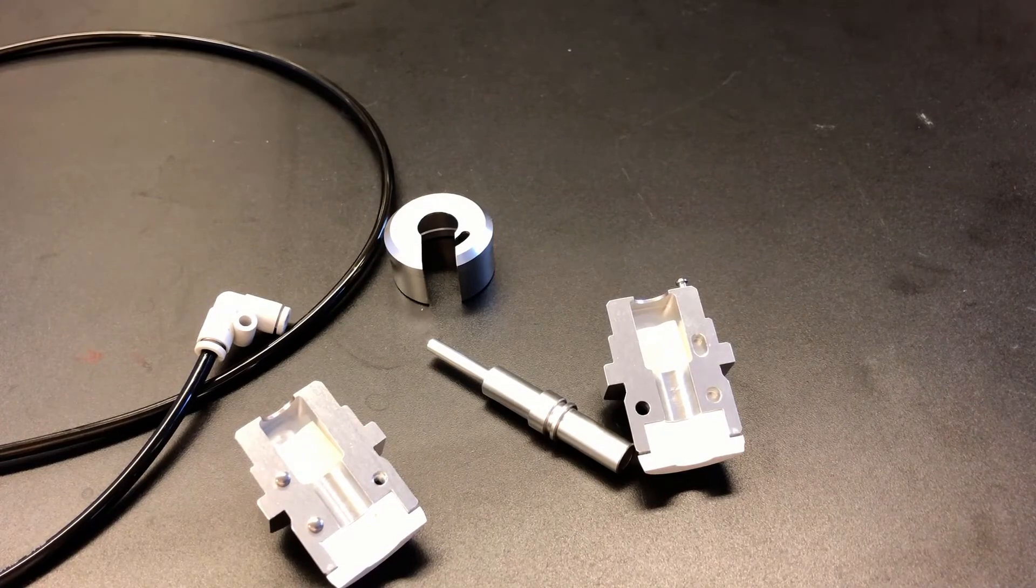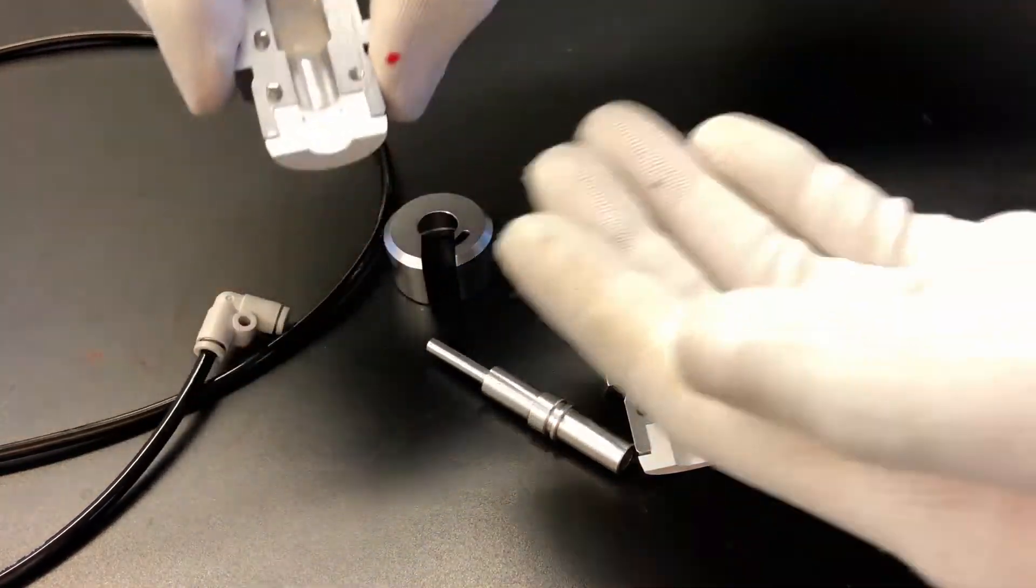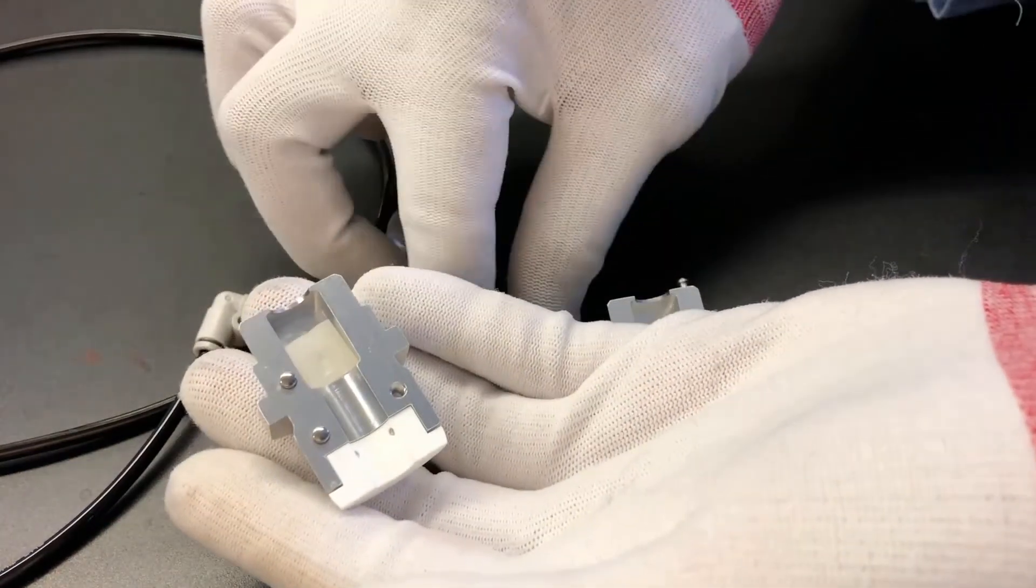If you'd like to flow nitrogen for an inert environment, find these components to set up the nitrogen flow. Here's how to set it up.